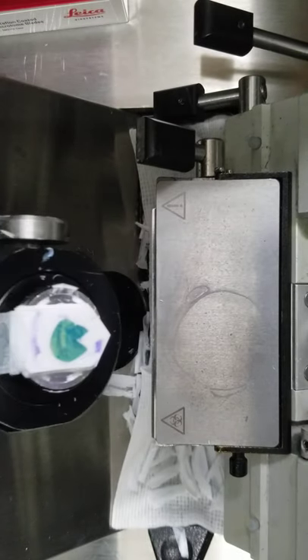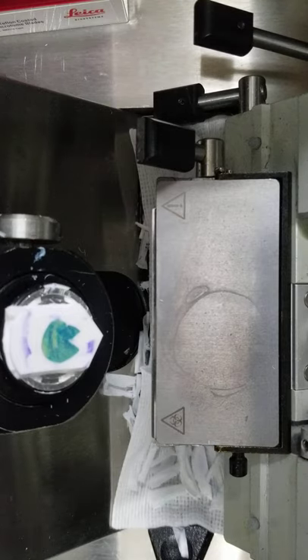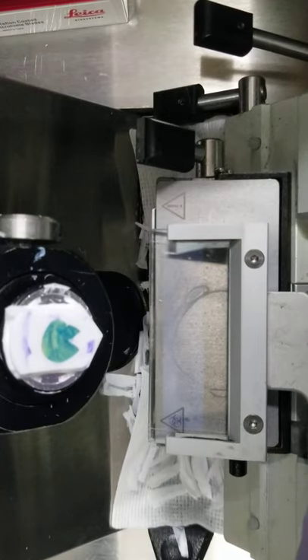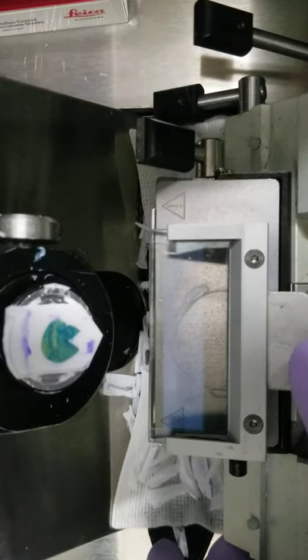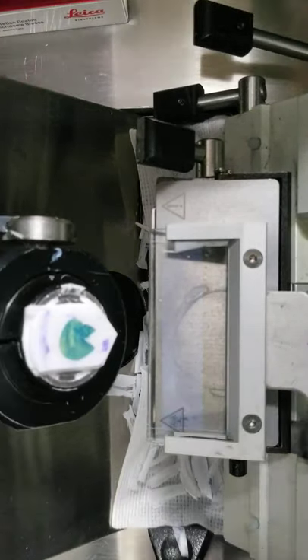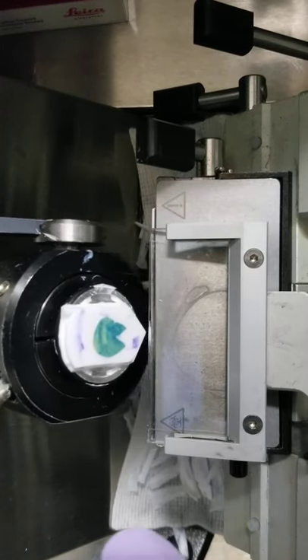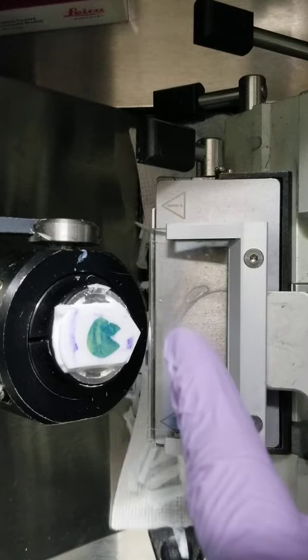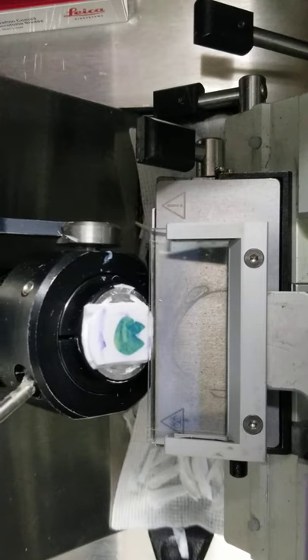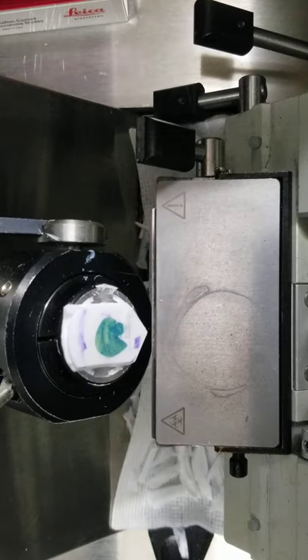How to actually adjust it, though, knowing if you need to move it forward or if you need to move it back, that's where the expertise lies. So let's say it is way too far forward. You will actually see the block hit, and it'll bunch up way in the front. You can actually hear it lightly tap on the glass, and you might be able to see the roll plate lift a little.